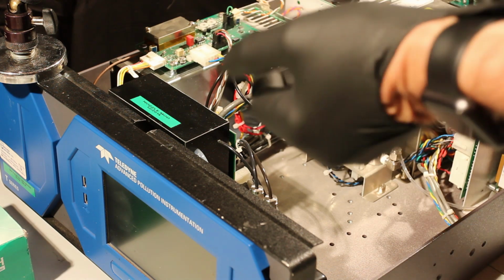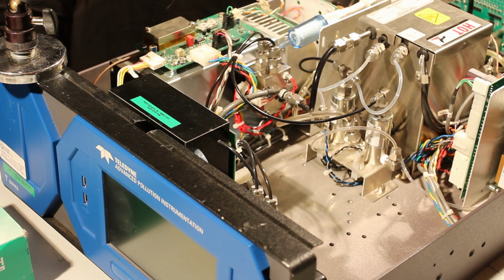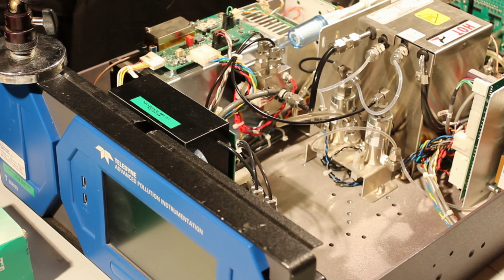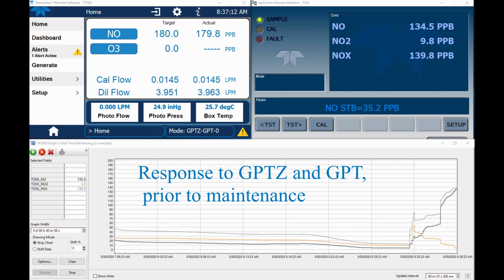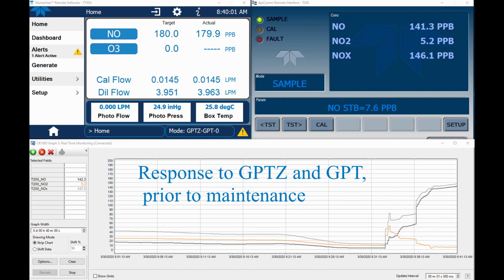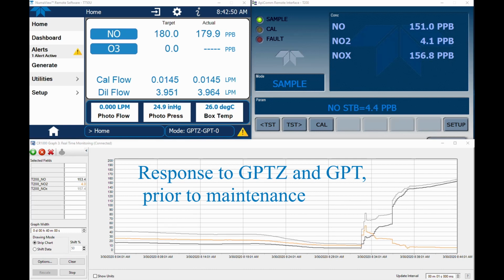your readings. As the reaction chamber becomes dirty over time, we must compensate by calibrating the analyzer, both via the offset and slope factors, which are considered software adjustments, and via the PMT gain, which would be considered a hardware adjustment. Over time, as we increase the PMT gain to compensate for a dirty reaction chamber, we also increase the noise of the measurement and increase the analyzer background levels. Properly cleaning the reaction chamber will allow us to reset the analyzer back to optimal factory performance.